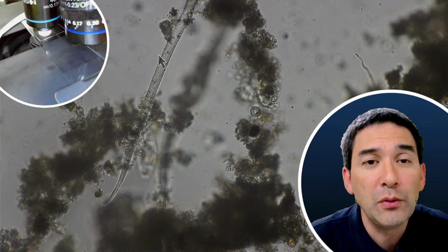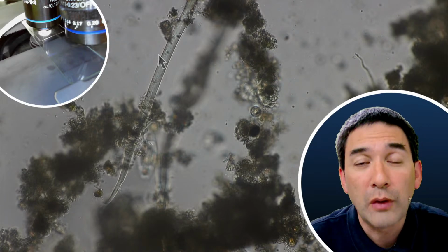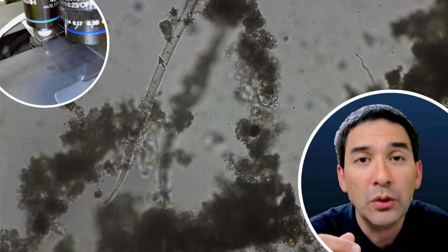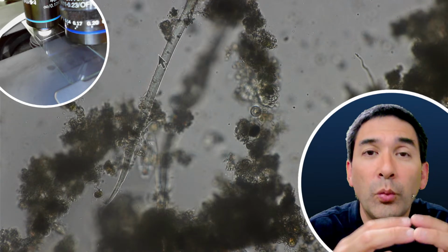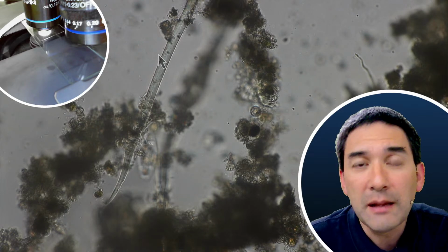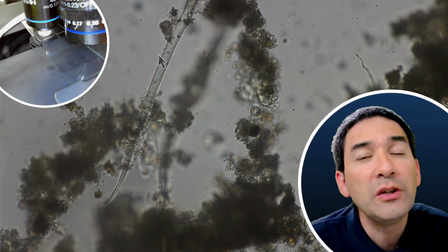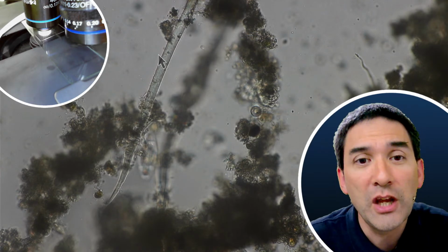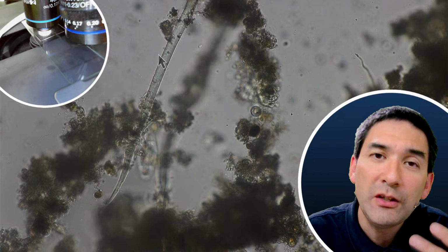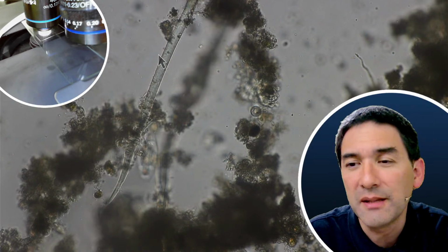So for example, if you've got dry pollen grains, which are much smaller, and you add Elmer's glue or water, then they will start to absorb the water and swell. So essentially, any type of mounting medium that you add might also change the sample, simply because the mounting medium interacts with the specimen.